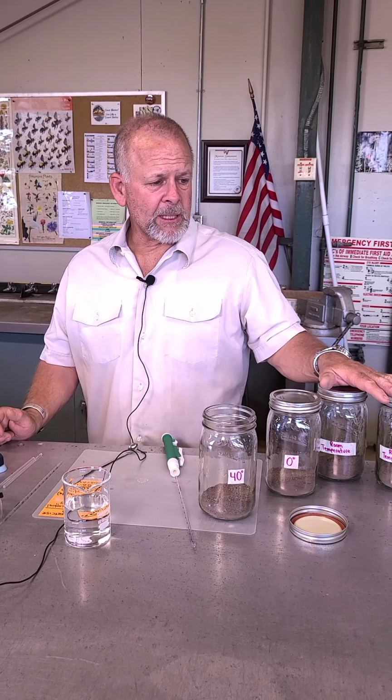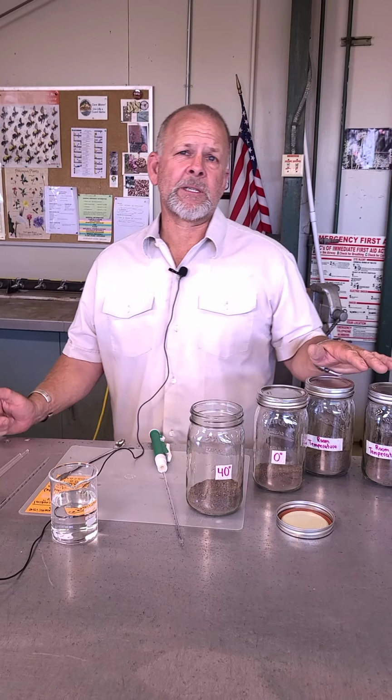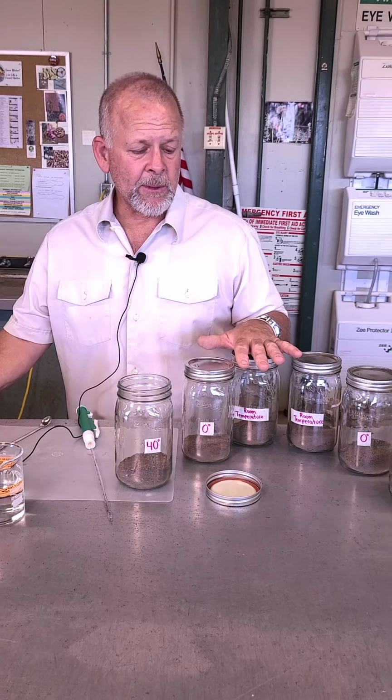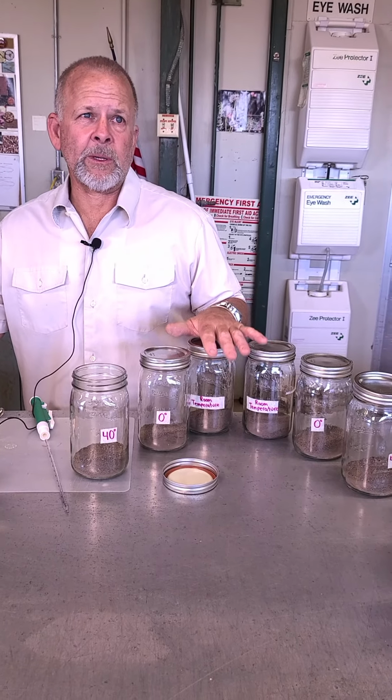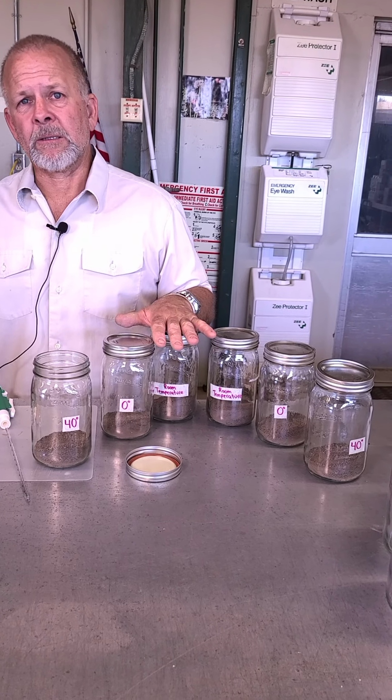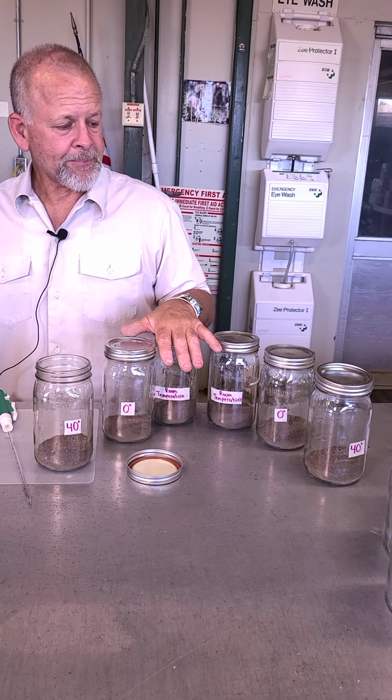We're going to run 2 replicates. That's the minimum that we should be running for any kind of a science experiment, the absolute minimum. If we screw up on one, at least we'll have some data. And believe me, I've screwed up plenty on this particular experiment, so it's good to have it.